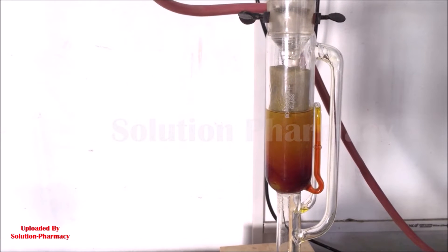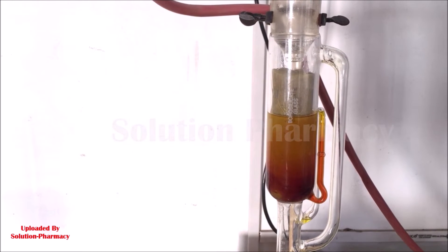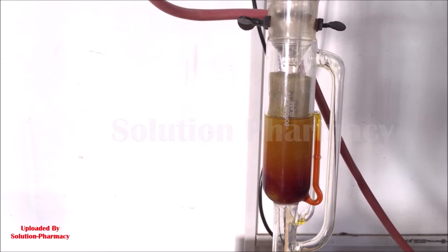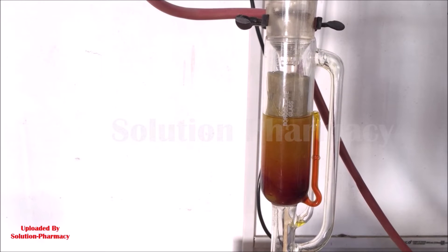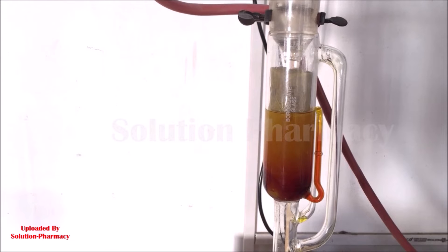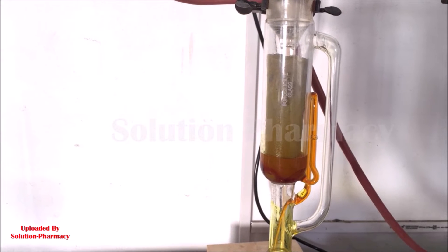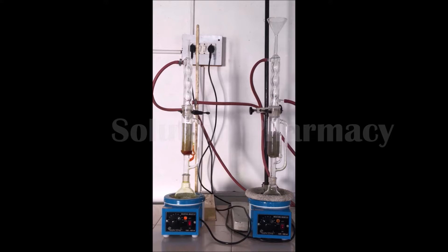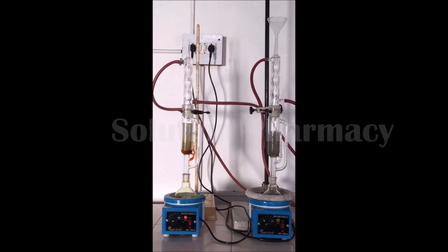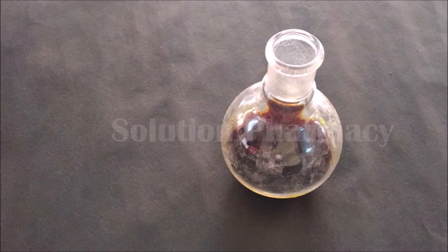The solvent extracts and solubilizes the chemical constituents present in the crude drug. You can see the solvent containing the chemical constituents in the siphon tube. When the liquid level reaches the tip of the siphon tube, the extract — the solvent containing chemical constituents — comes back to the round-bottom flask from the extractor. This cycle repeats again and again, extracting chemical constituents from the crude drug during each cycle. We have to continuously run the cycles until complete extraction of the crude drug. After the extraction process is completed, you can see the liquid extract in the round-bottom flask.